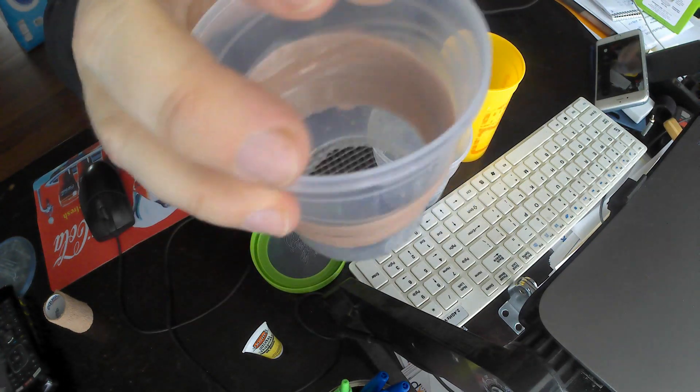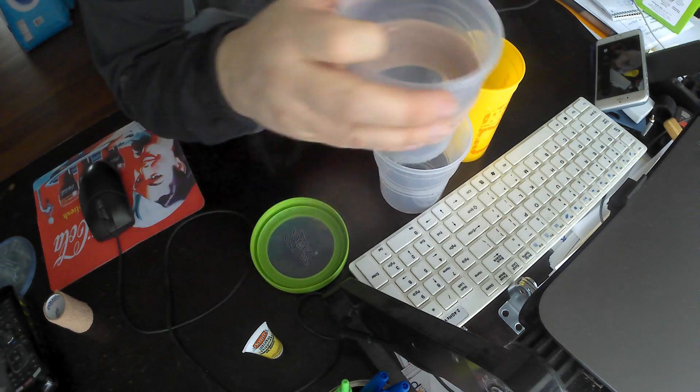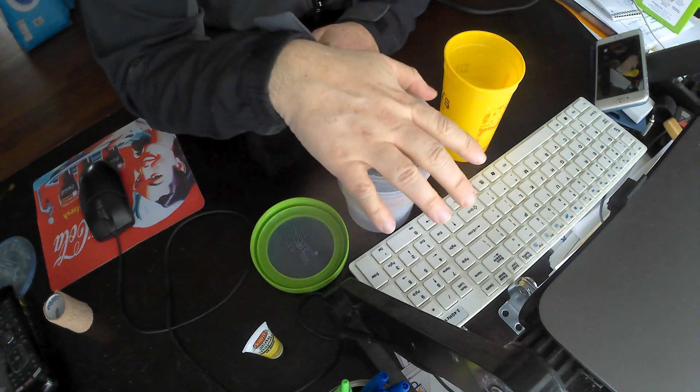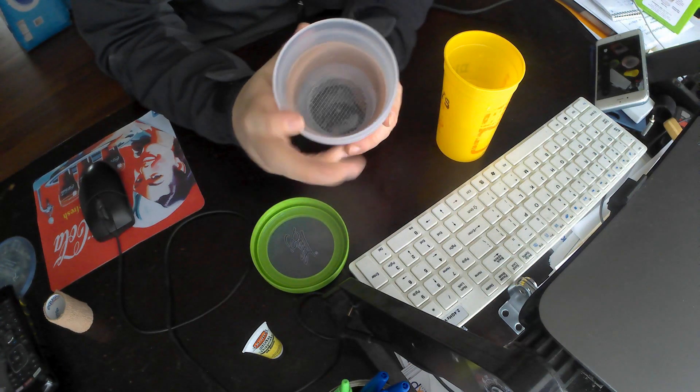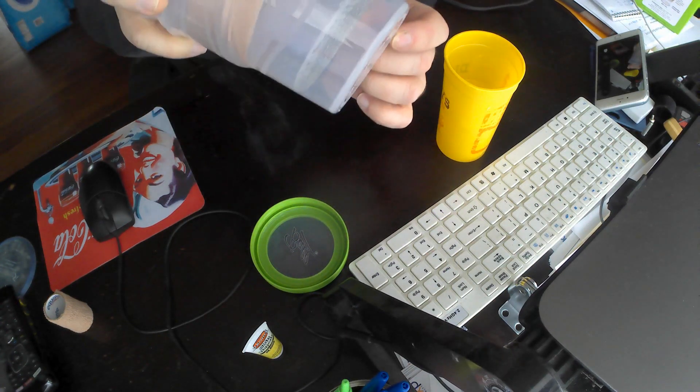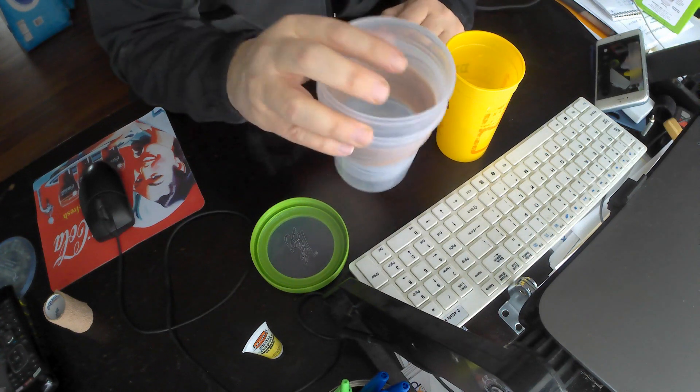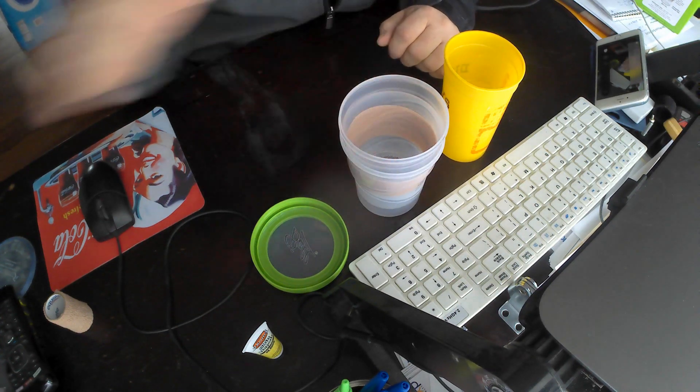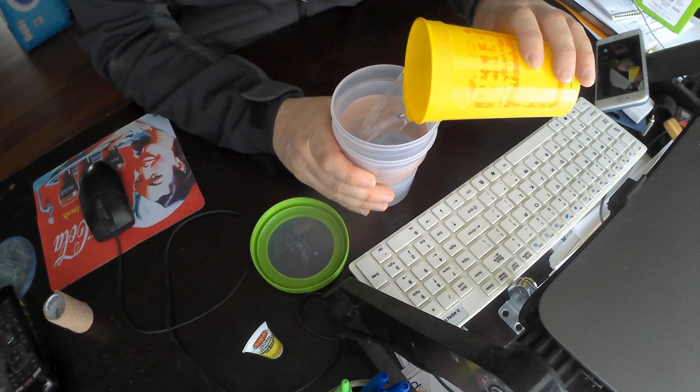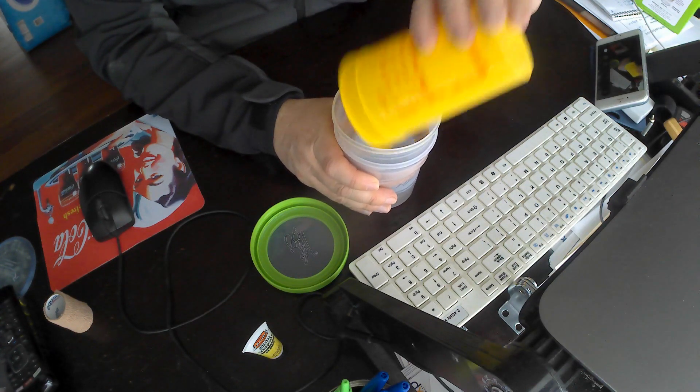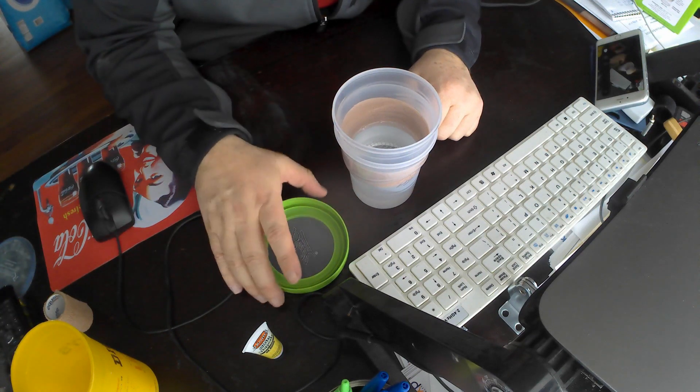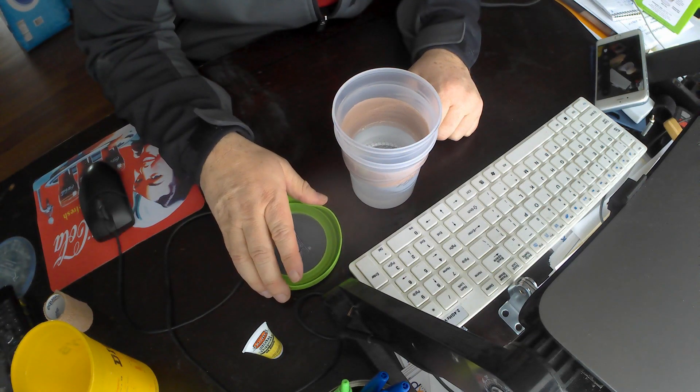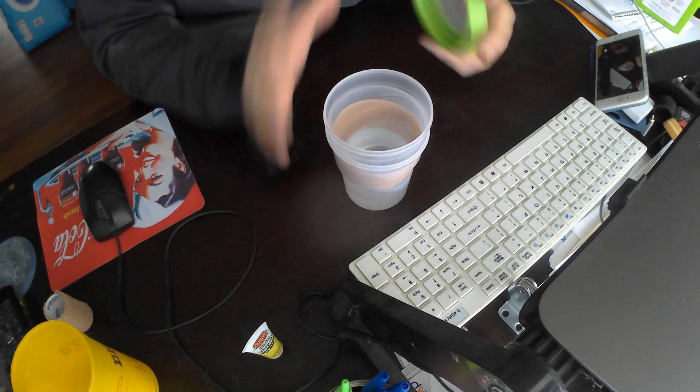So, that's your cup portion that you dump your bees in. I put it all together first, set it down nice and tight. It leaves a nice gap at the bottom there where you can look at the mites that fall through. Then just simply pour your alcohol in to the level that you want it. Pour your half cup of bees or whatever amount you're using. I usually use about a half cup of bees in there.